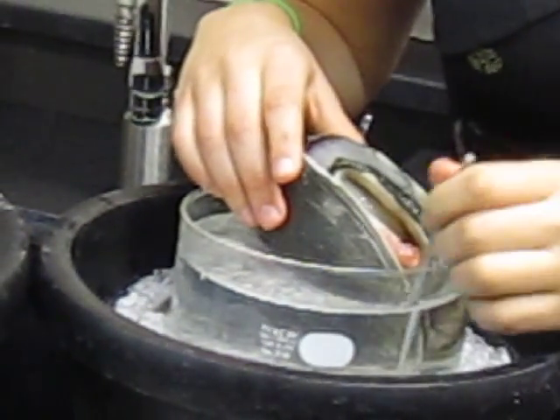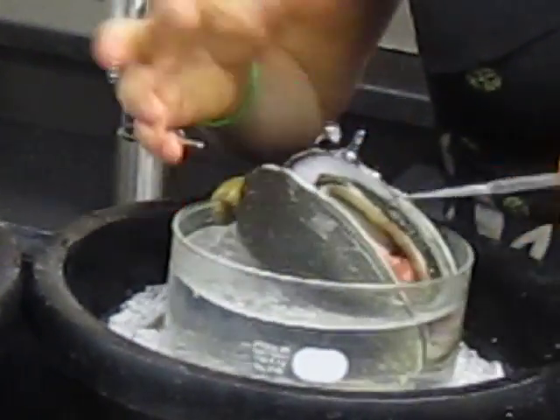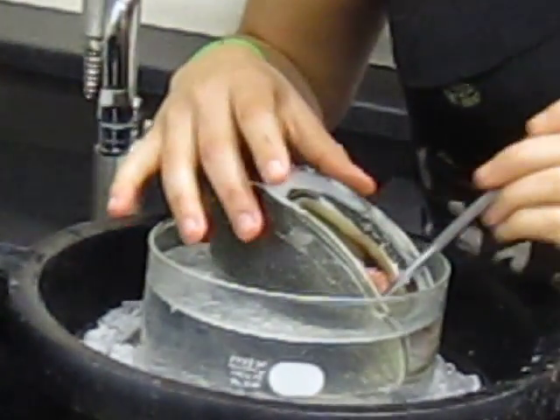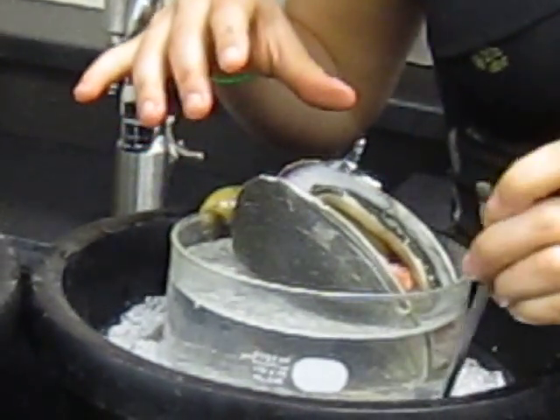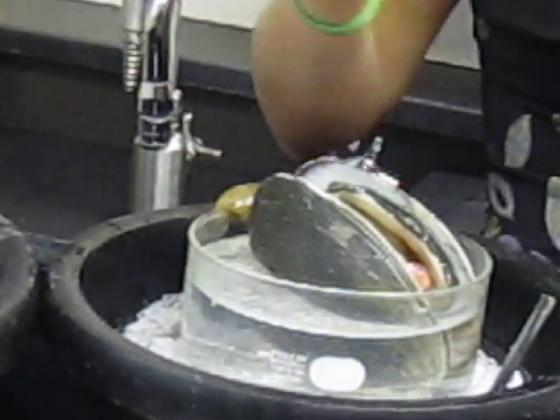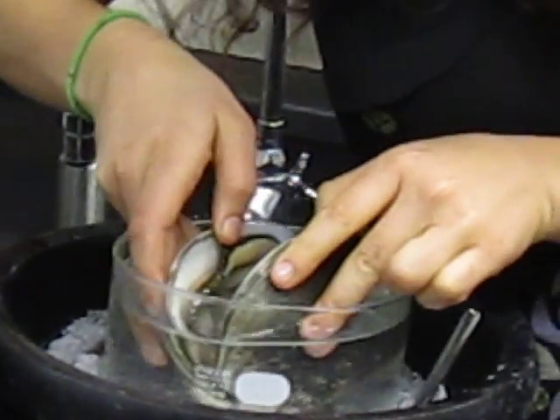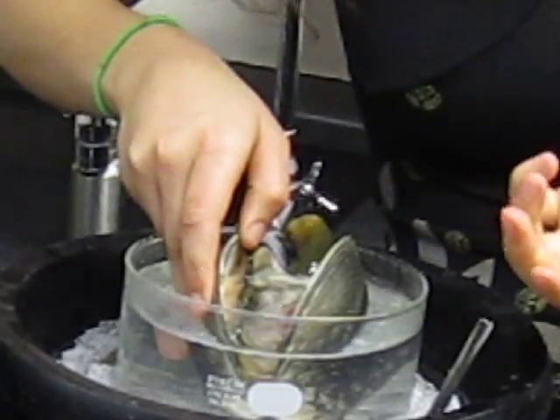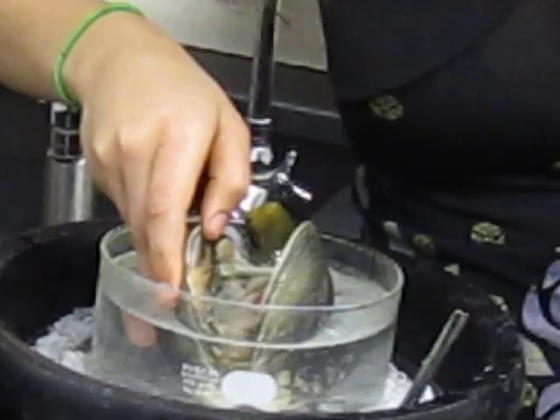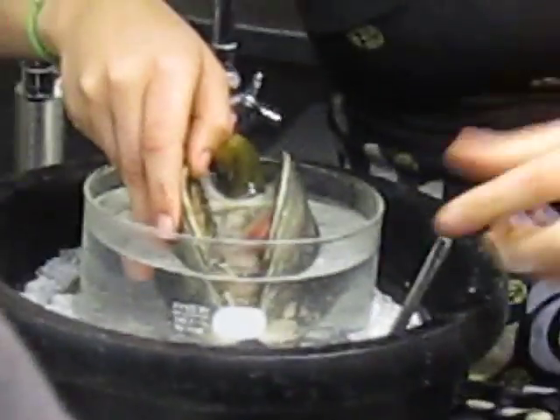And they're a little bit sticky, which is also helpful in capturing food. So ctenidia will help bring the water in, and then after going through the mantle cavity, it'll reach the labial palps. Labial palps, you really have to get close to see these. Basically like lips, like you can pick things up with your lips and then ingest them. This is basically their analog to that. So if you come really close, I'll show you them.